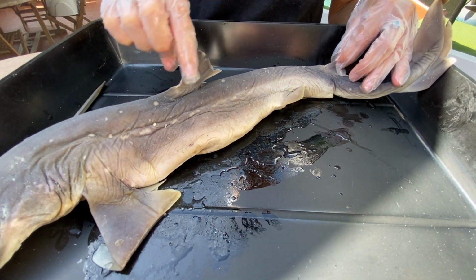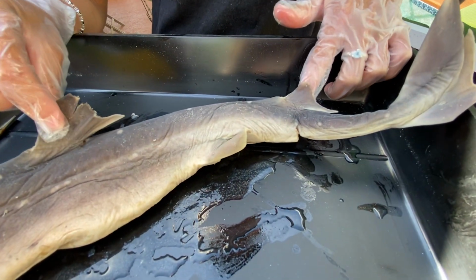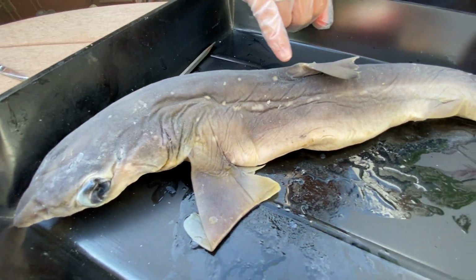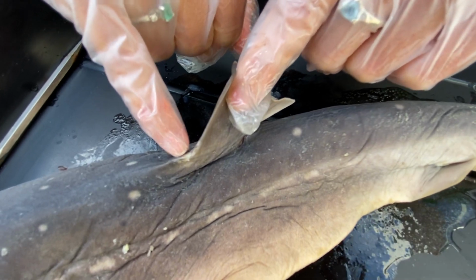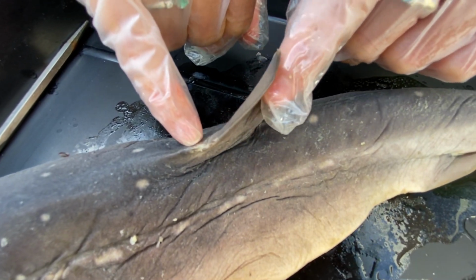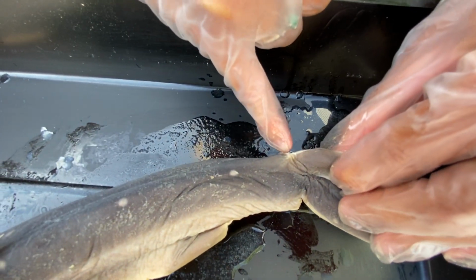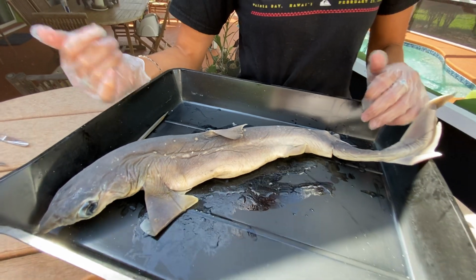This is considered your first or your anterior dorsal fin. And then this right here is your posterior dorsal fin. Anterior, so the head region is anterior, tail is posterior. Anterior to each dorsal fin used to be a spine. There's a spine right here, hence why it was called the spiny dogfish. And then there also was a spine anterior to this second dorsal fin. They have removed the spines just to protect us a little bit more.